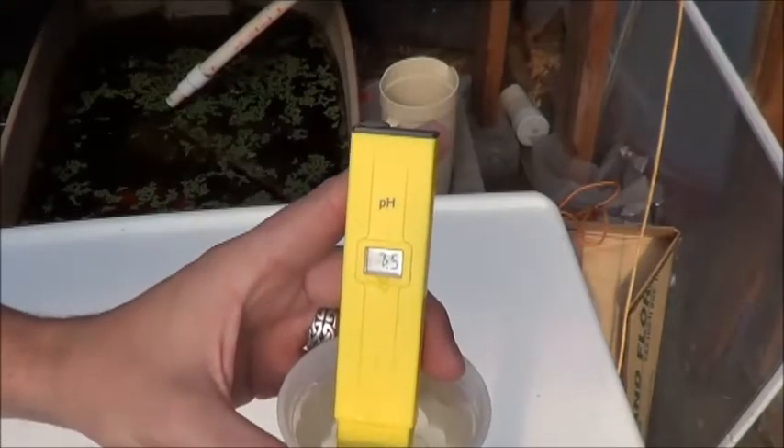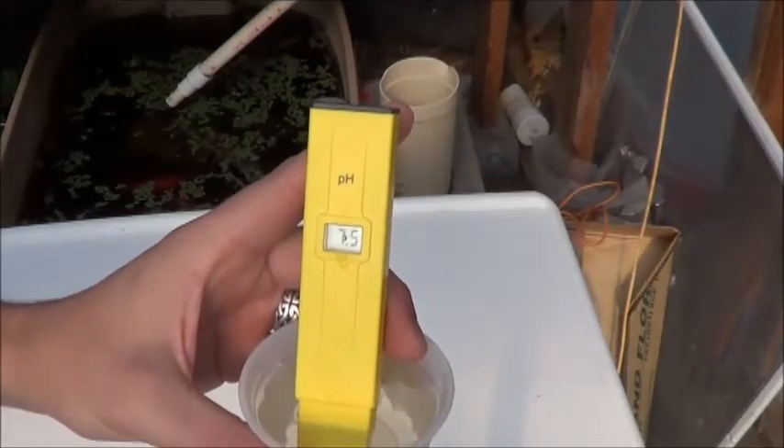I think the lesson here is, let's never forget there's always room for me to screw things up. I was excited, I wanted to try, I wanted to calibrate it and find right out. And foolishness is still just foolishness all the same, isn't it? So I'm going to check that reading a couple more times with a few different samples from that same tank and see what we get as an average. Once again, 7.5. Well, that sounds a whole lot better than 4.9, doesn't it?